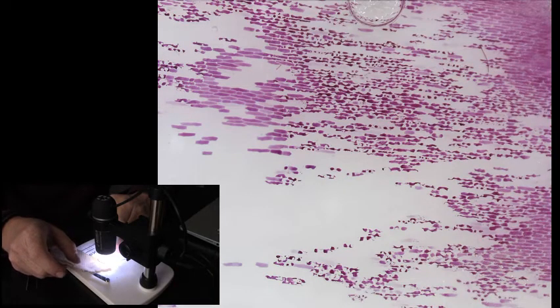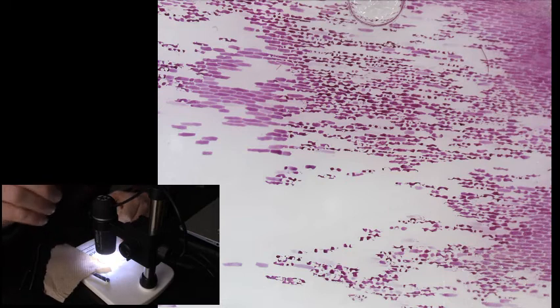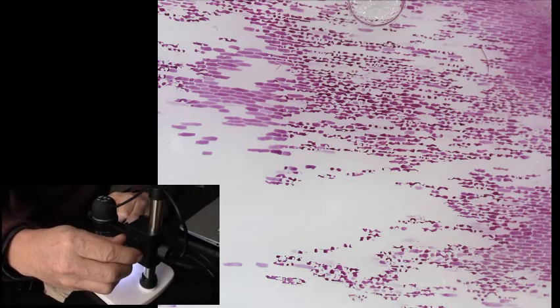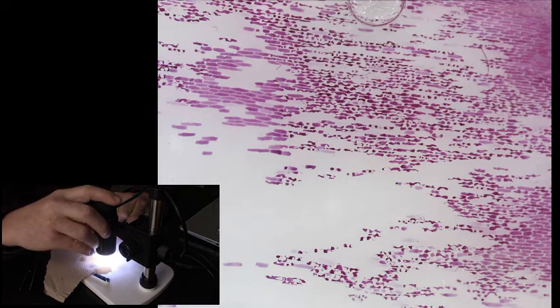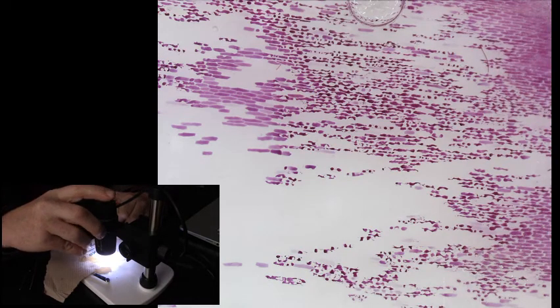So it goes from high concentration in the cytoplasm to low concentration, the water that I added. And so essentially water is drawn out of those cells, shrinking up the cytoplasm.